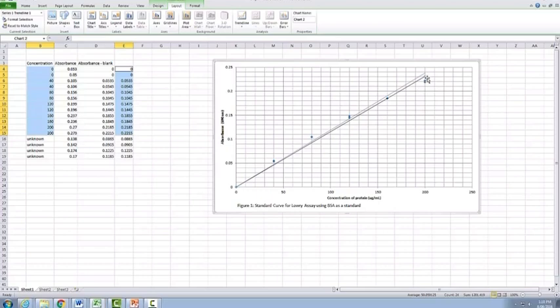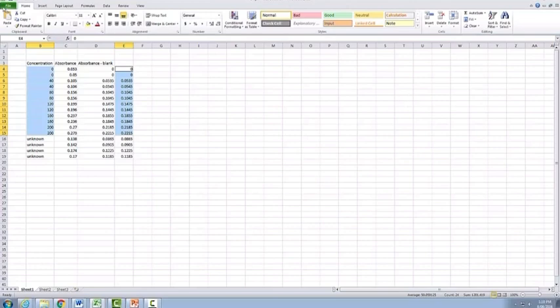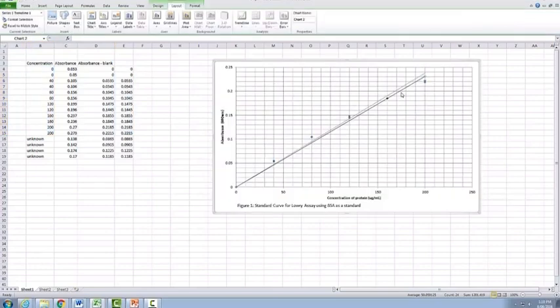The trend line itself that Excel has drawn, I don't think is very good, because it's actually got too many points above the line and not very many under the line. So I'm going to delete the trend, whoops, don't want to delete the whole thing. I'm going to delete just the trend line itself, and keep my line that I've drawn in myself.